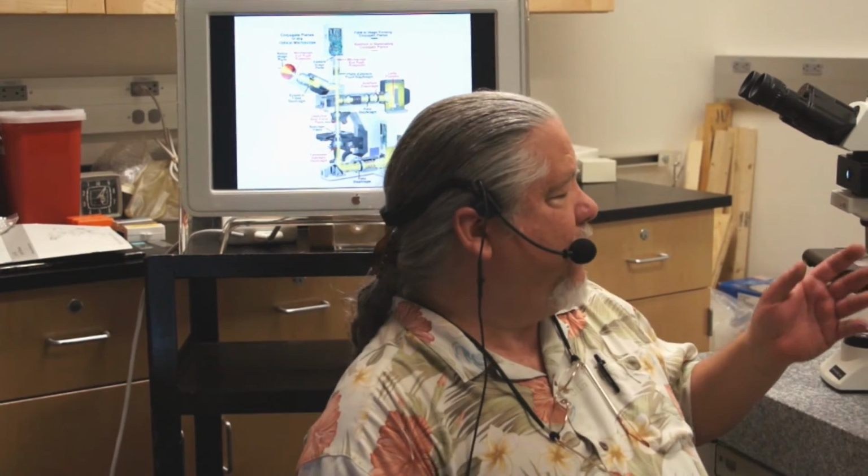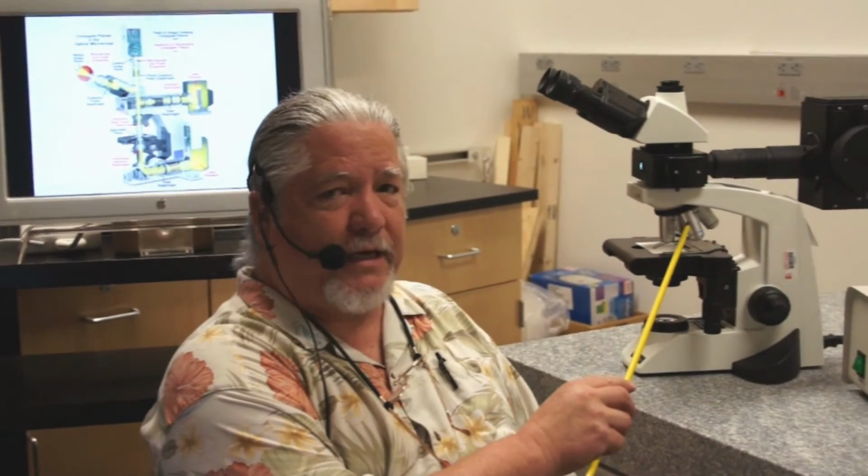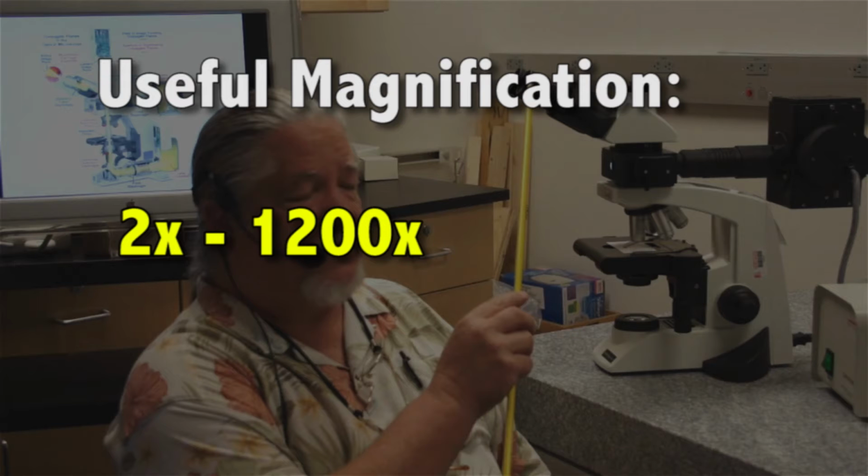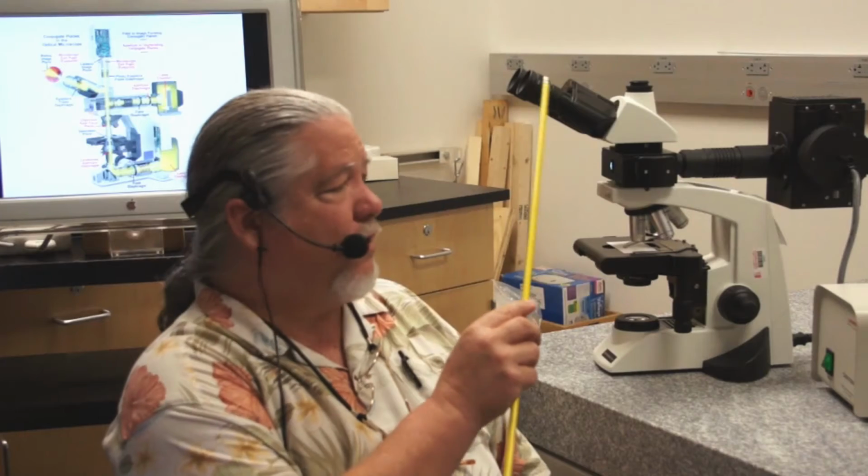The reason this is called a compound microscope is because to get the resultant magnification out of the instrument, you multiply the magnification of the objective lens times the magnification of the eyepiece lens. Ergo, this is a compound microscope, and there's other features that we're going to discuss as we go along. Useful magnification for an instrument like this is about 2 power up to maybe 1200 power. You really can't go any higher than that and still maintain the resolution that you're looking for in a microscope.